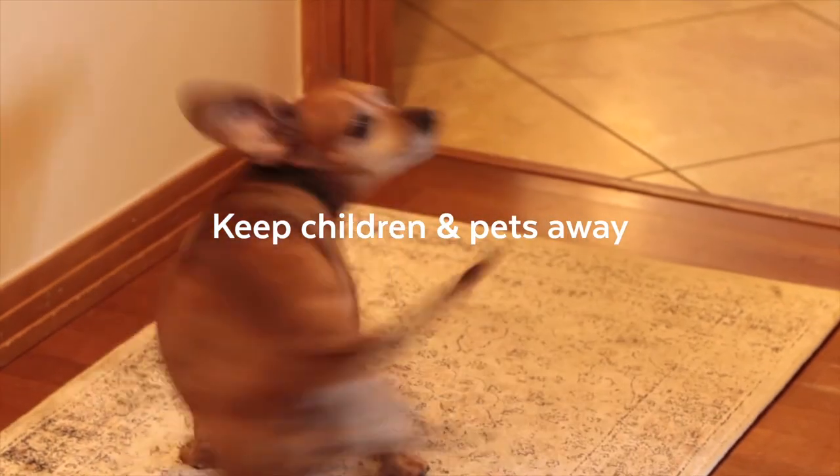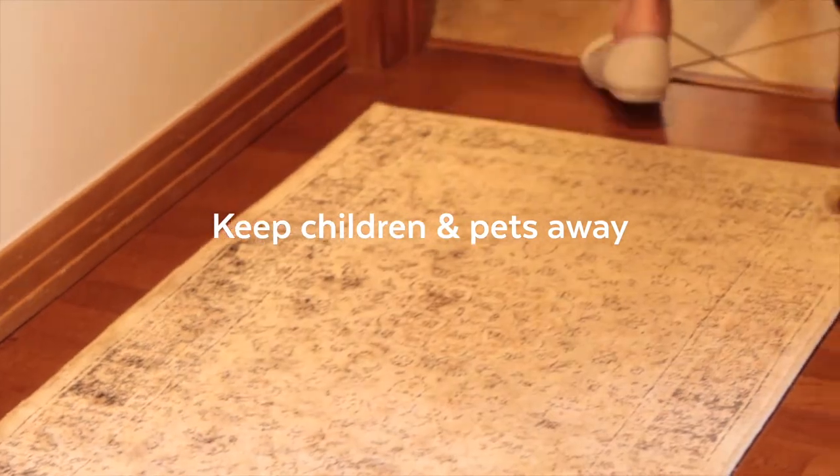During the one hour of testing, rooms can be used as normal during sampling. Please keep children and pets away from the mold test plates. It is very tempting for little ones to touch or even lick the agar. However, rest assured that the agar is not harmful to children or pets.